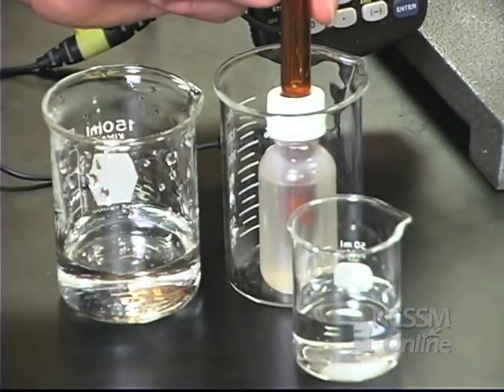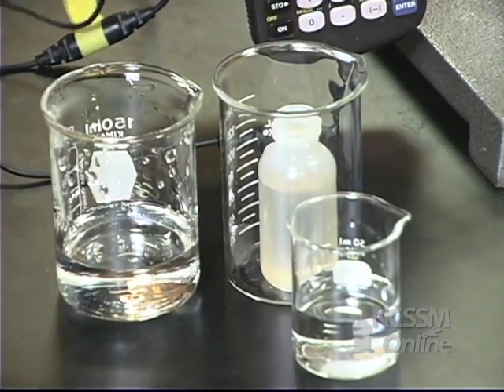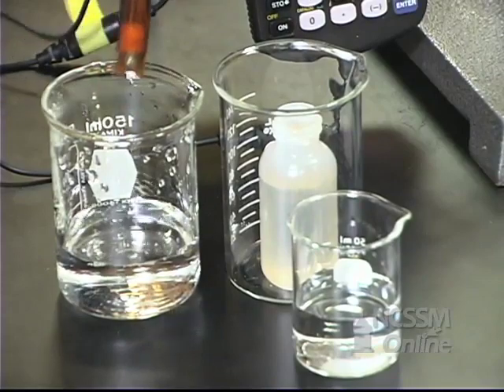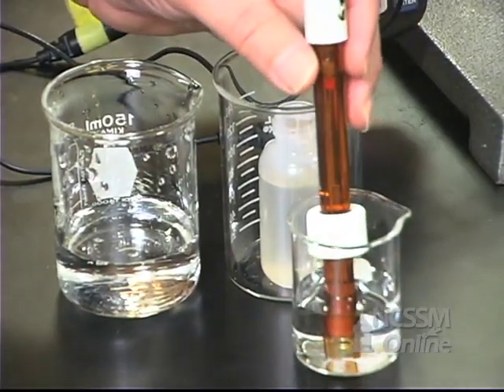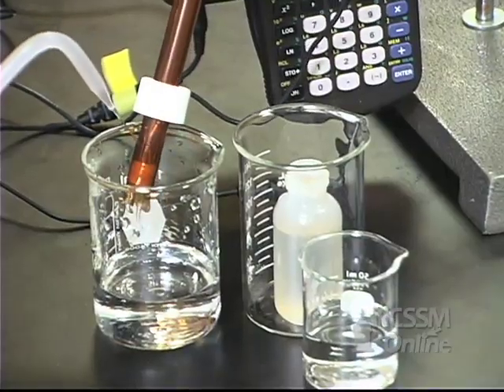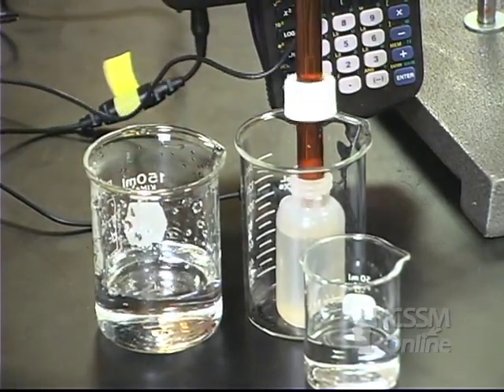We're now going to read the pH of the calcium hydroxide solution. I'm going to take the pH probe out of the storage solution, rinse it with some distilled water, and place it into a saturated solution of calcium hydroxide. I'm going to read the pH from the CBL screen, then rinse off the probe and return it to the storage solution.